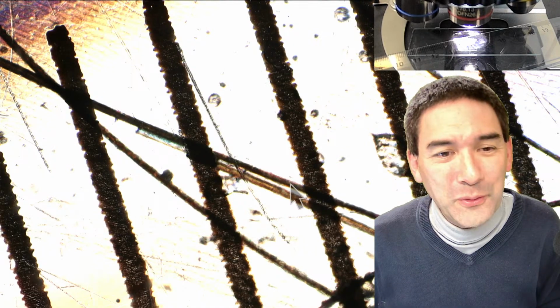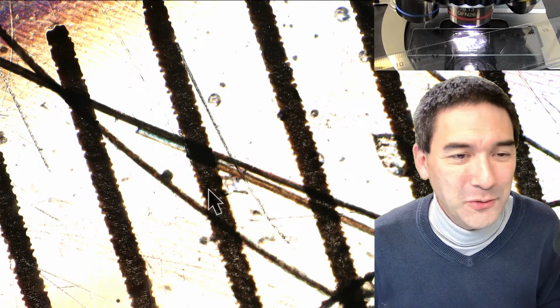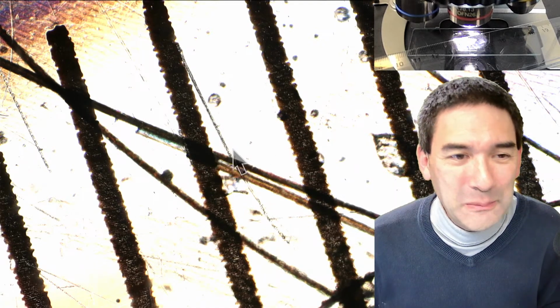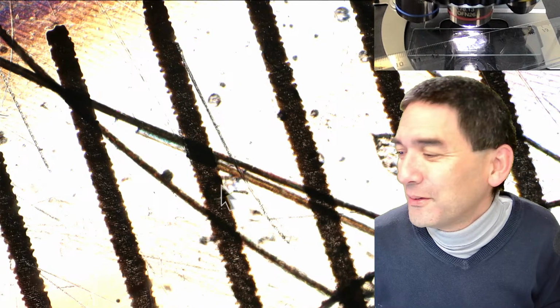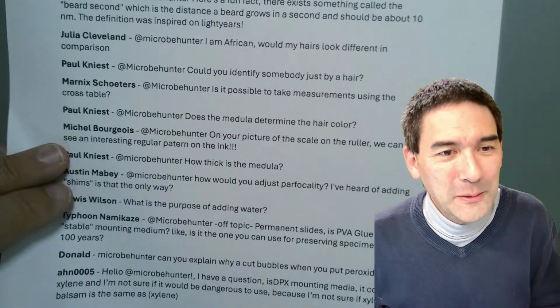You cannot get both into focus, but you can imagine it from over here to over here, in 1 millimeter. Maybe you're able to put 10 or 20 hairs next to each other. So this basically means maybe about a tenth of a millimeter. That's also a coincidence here. You just put them together on a ruler, and then you can make a comparison. So let's go on.